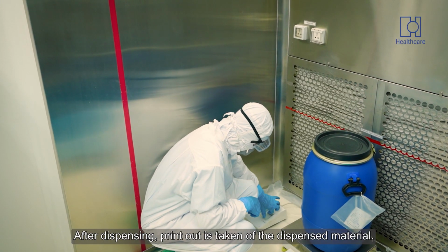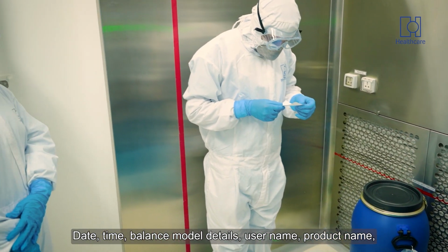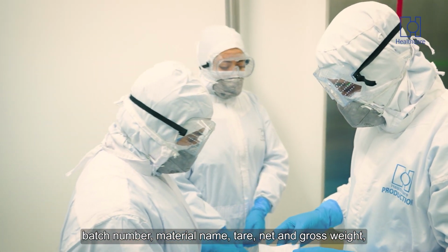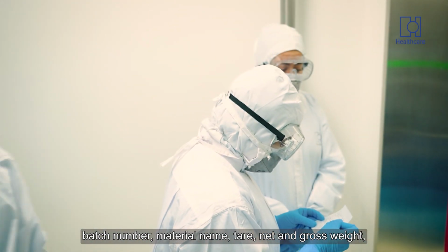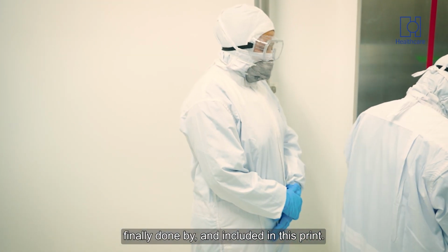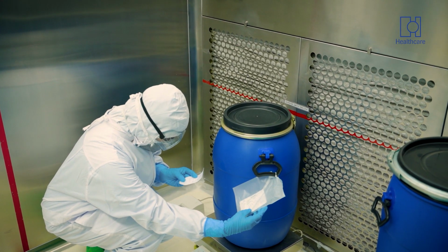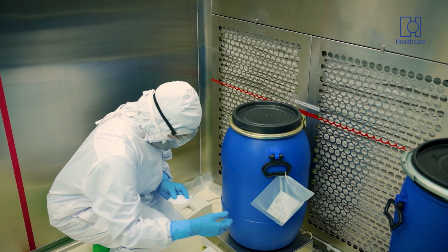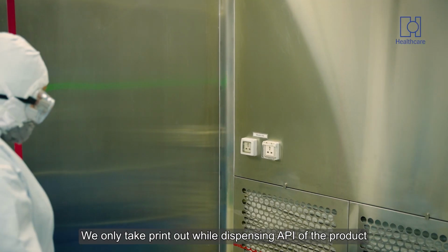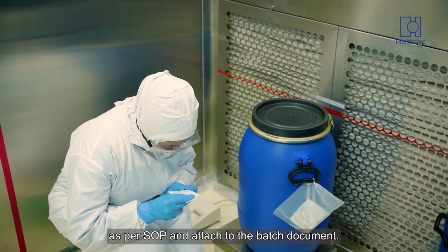After dispensing, a printout is taken of the dispensed material, including date, time, balance model details, username, product name, batch number, material name, tare, net and gross weight, finally done by and included in this print. We only take a printout while dispensing API of the product as per SOP and attach it to the batch document.